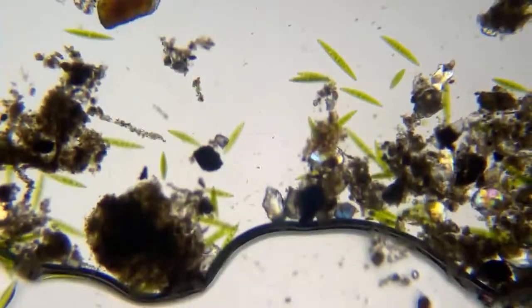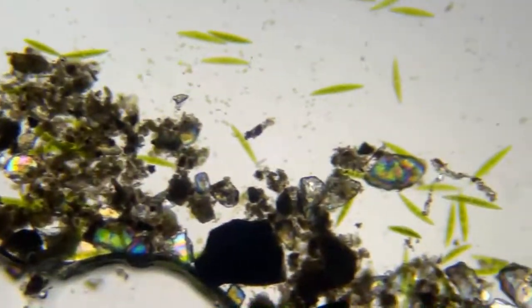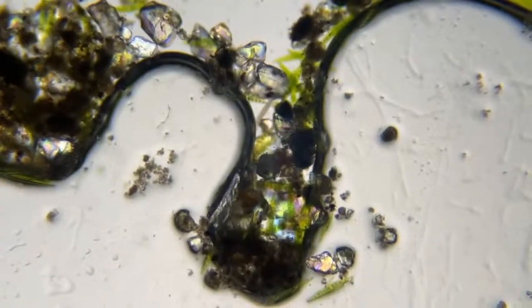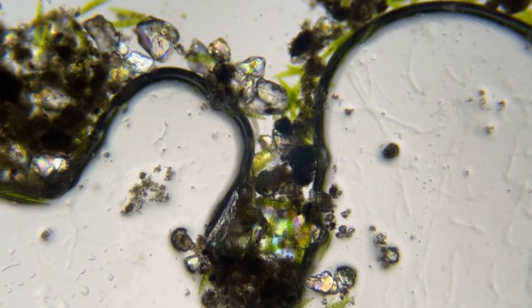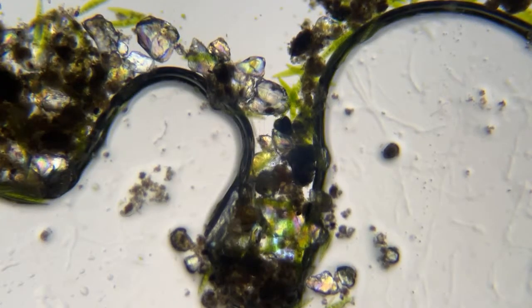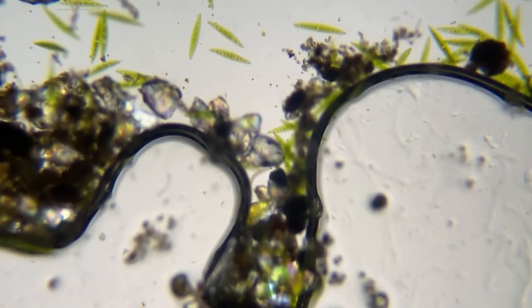And it zoomed back and forth. But where did he go? Is he hiding in here? Oh, there he is. Why did he go? Did he go way in there? Is that him or is that something else? Boy, why does he have to go in there?